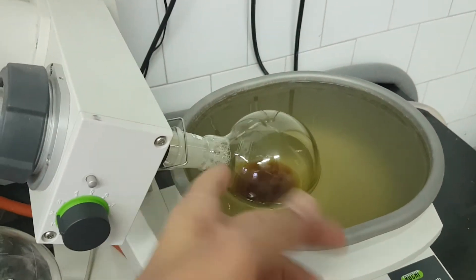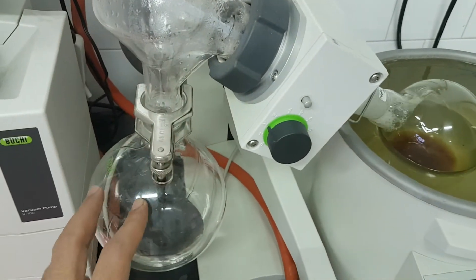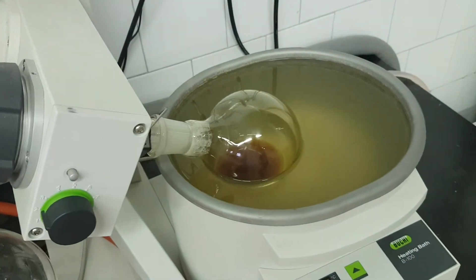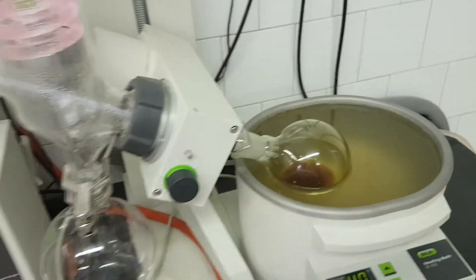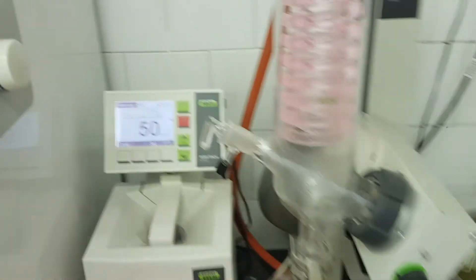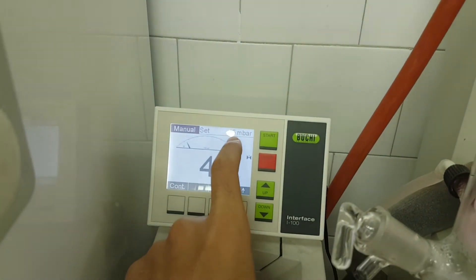If you have a large amount of bubbles, your molecules will come up through the tube and come down, and then you will lose the concentration of your mixture. So go very, very slowly. I'm decreasing only by one — look, I have 45, I'll decrease only one.